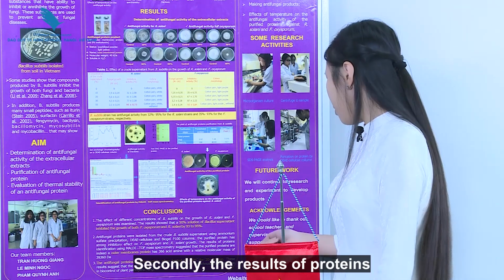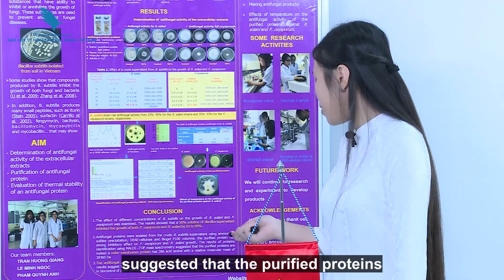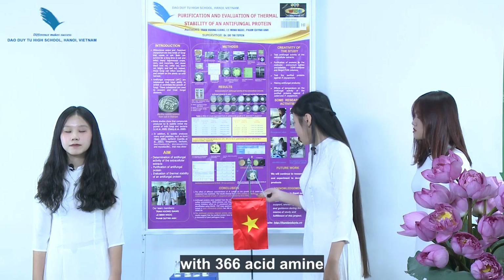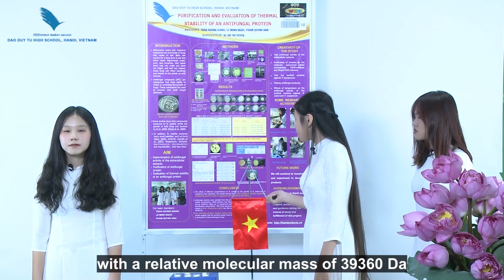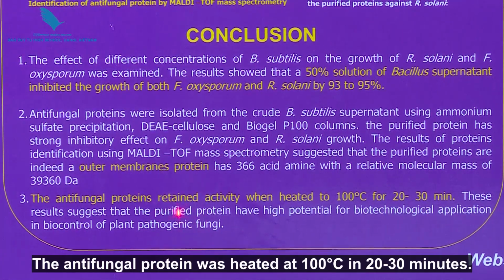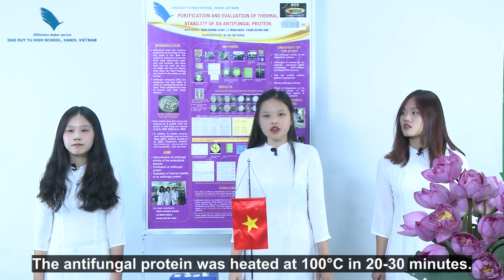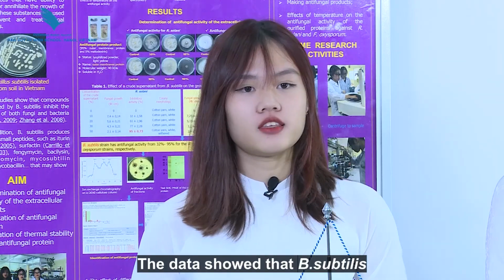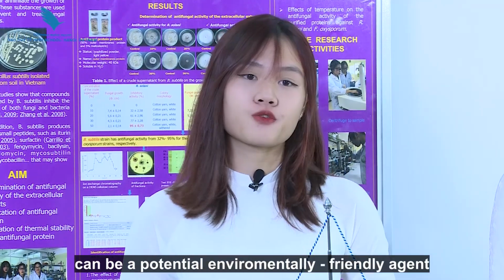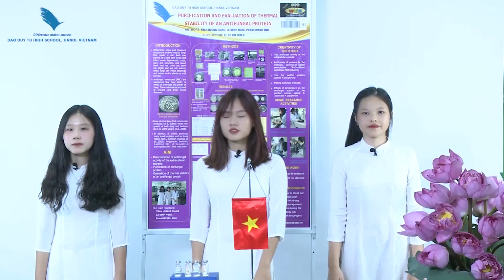Secondly, the result of protein identification using mass spectrometry suggested that the purified protein is indeed an outer membrane protein with 366 amino acids, with a relative molecular mass of 39,360 Da. The antifungal protein was heated at 100 degrees Celsius for 20 to 30 minutes. The data show that Bacillus subtilis can be a potential environmentally friendly agent to control plant fungal disease.